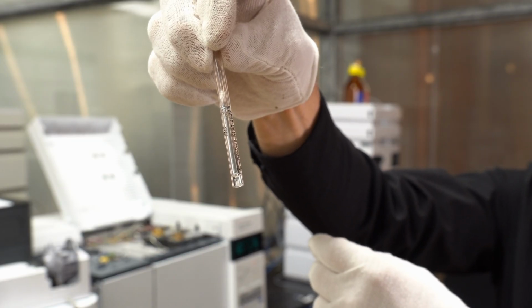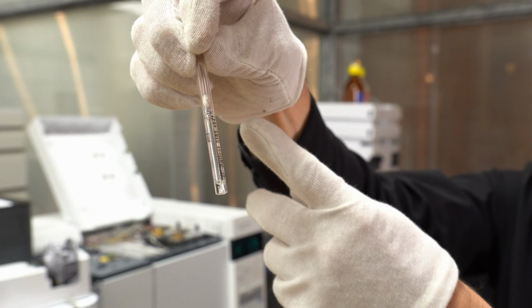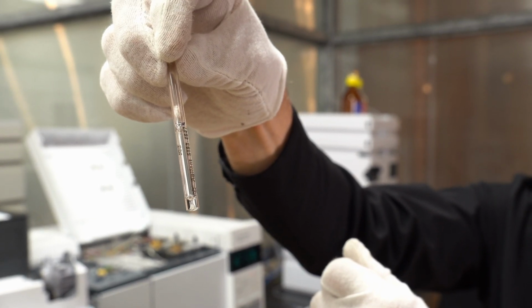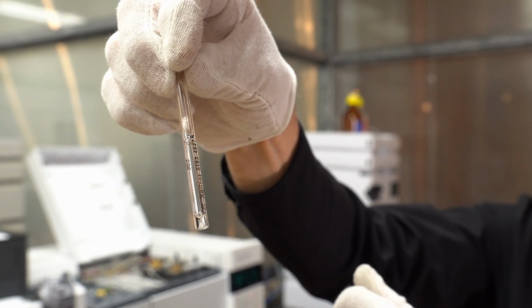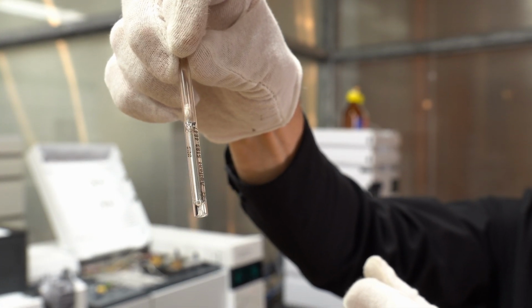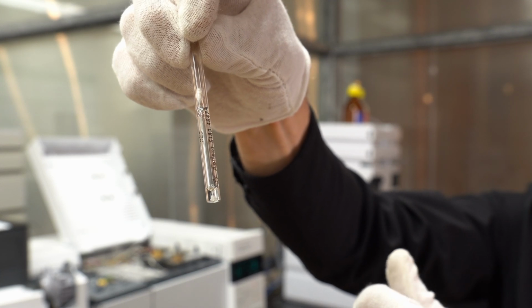So if you look at the glass wool, I think you probably see a little dirt inside there. I always look at the glass wool and then also look down towards the bottom to see if there's any graphite swimming around down there. A little graphite, a piece of the ferrule can make it down there and cause adsorption and tailing issues. So in real life, you often cannot see the problem if it's there. We could only see it by looking at the tailing peaks.